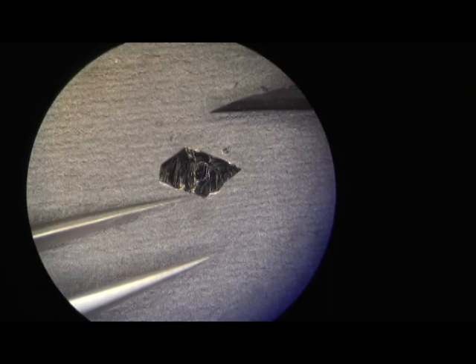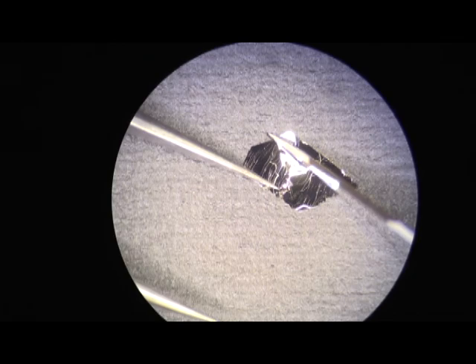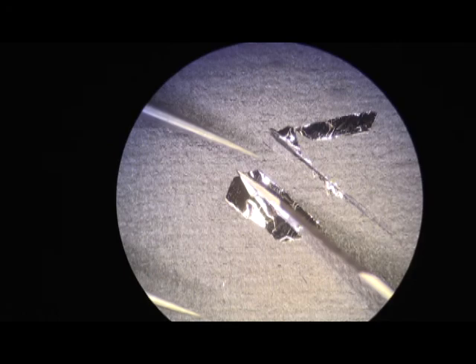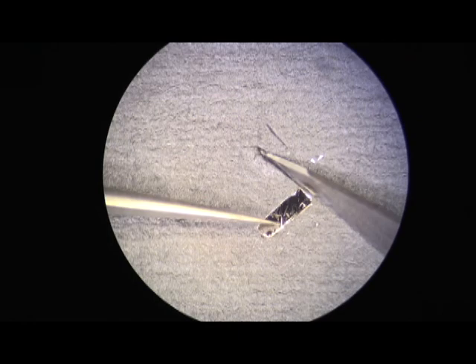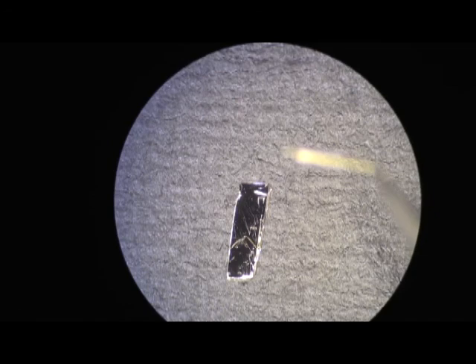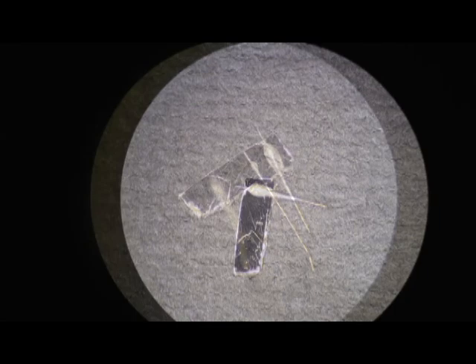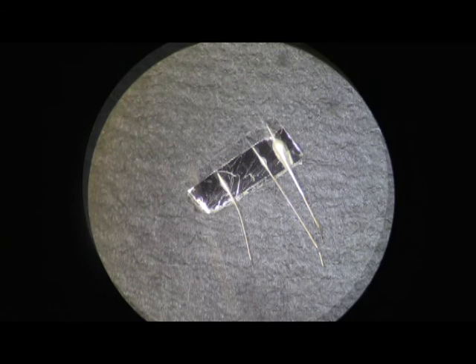We use a blade to cut the crystal into a specific shape. Different shapes are used for different kinds of measurements. Gold wires are then glued to the surface of the crystal. These wires are thinner than human hair. We use these wires to apply and measure voltages on the crystal. These voltages are the main signal that we use in our studies of the crystal.